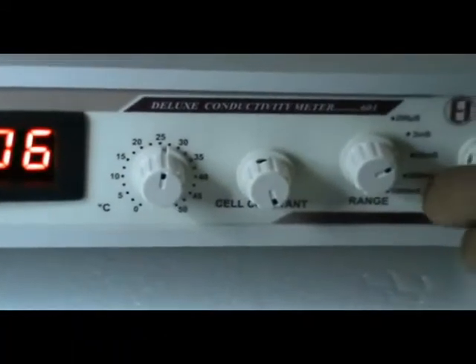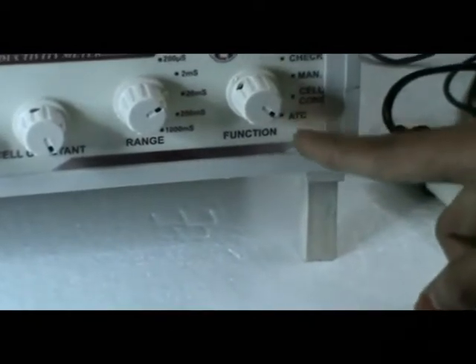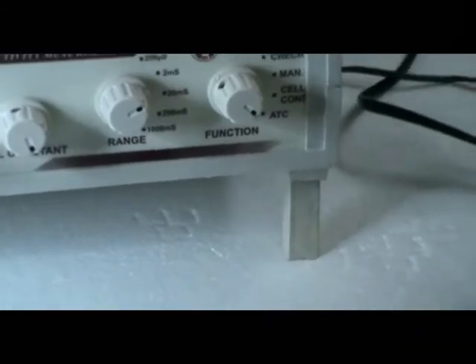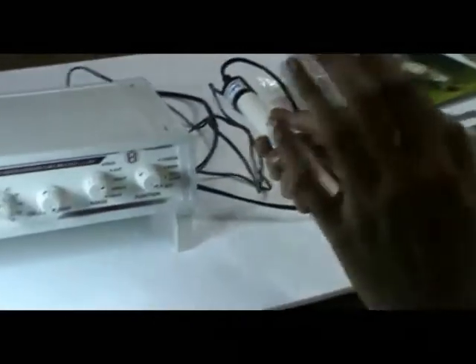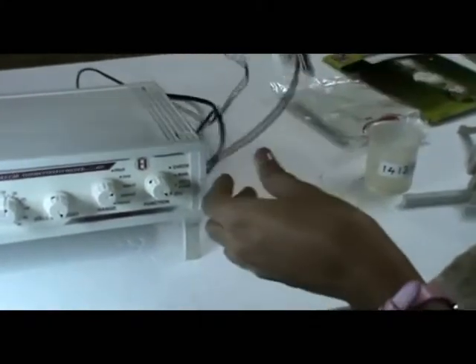After that, change the function switch to ATC mode. If there is any temperature variation in your solution, you need to check ATC mode. At that time, dip the connected cell and temperature probe in the solution.